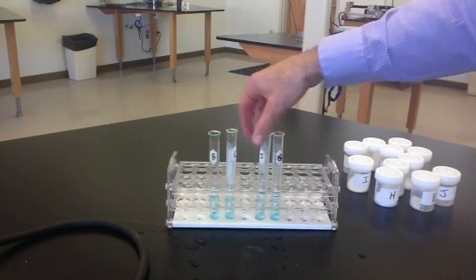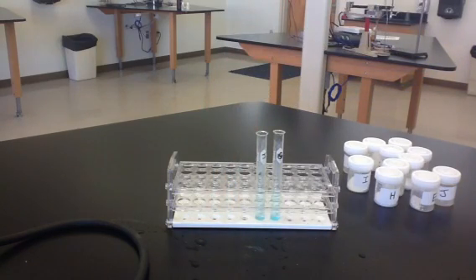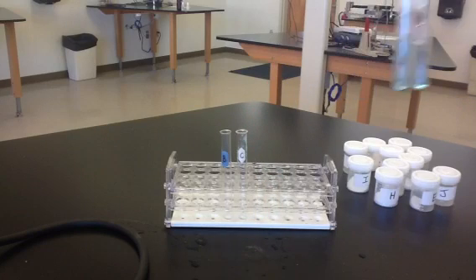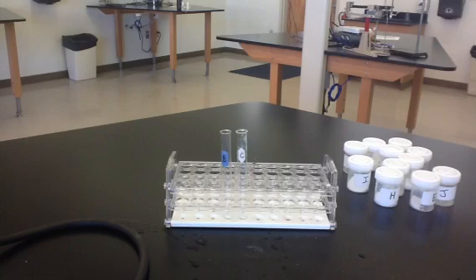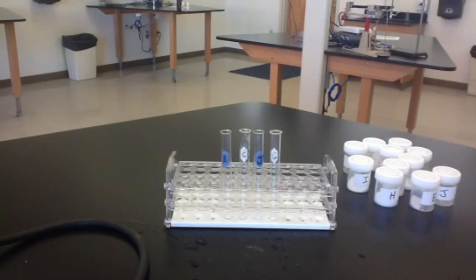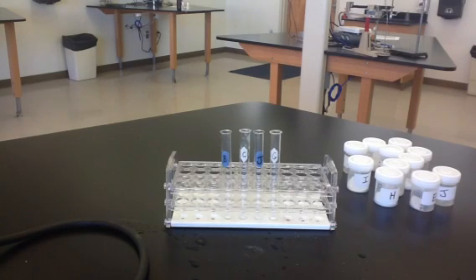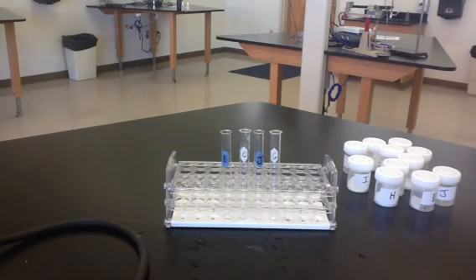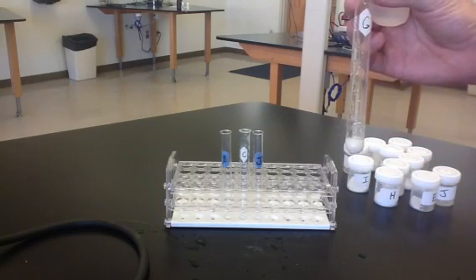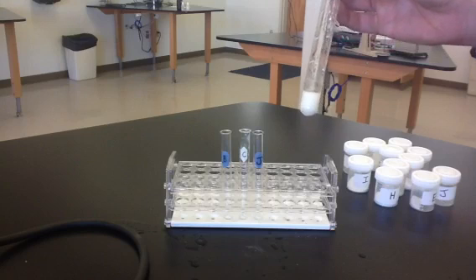We'll need to get new samples of B, C, J, and G in order to do further tests. The next test is going to be whether they react with vinegar. We'll do it with G first, and we see that we do get a reaction — the other substances will not react with vinegar, but we definitely see bubbles forming and gas being produced when G reacts with vinegar.